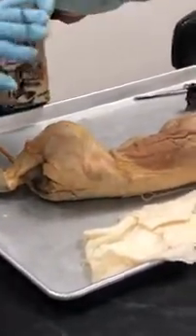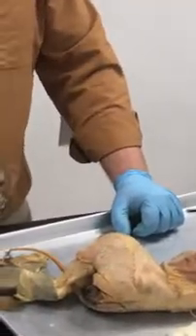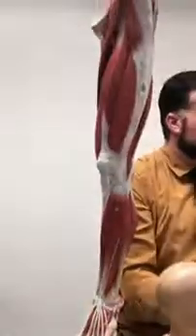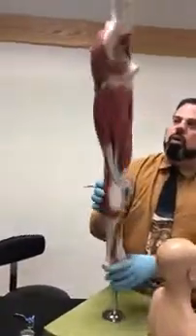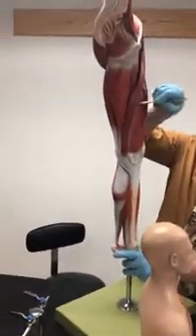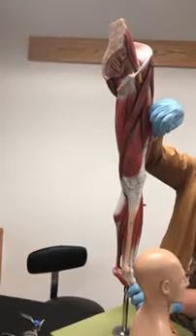That's it. Now, just as a summary, that I did with the other group, let's just go through the leg muscles, go right around like you're circling the earth. Let's just do the same thing with the human, and then we'll do it on the cat, and then we're done. Okay? All right. So, let's start off with what you already know, the sartorius. There's your sartorius. We'll go right around. What is this muscle? Vastus medialis.